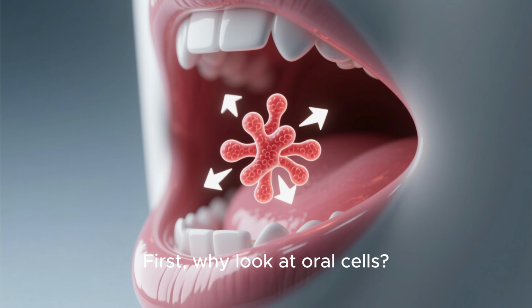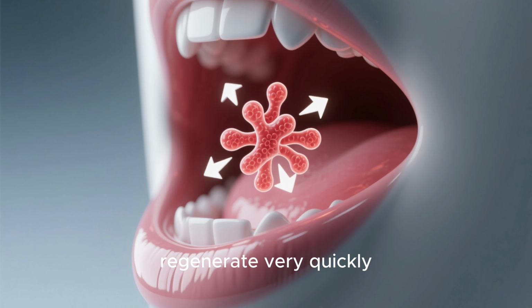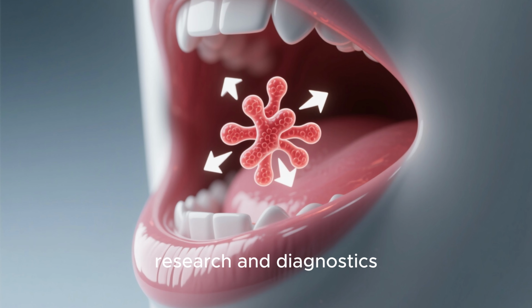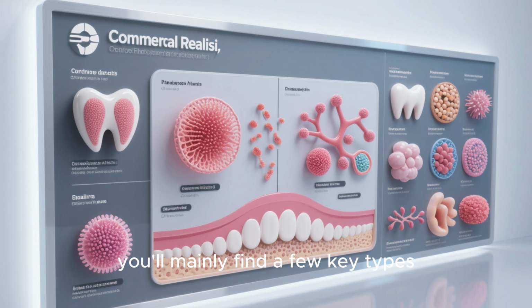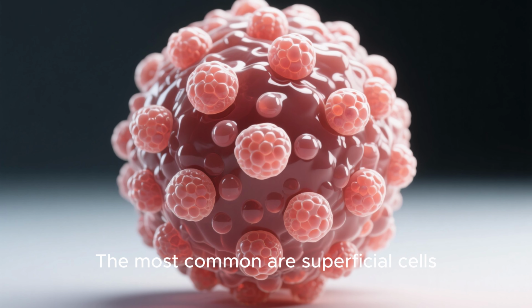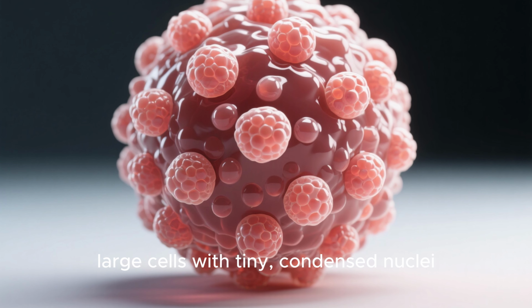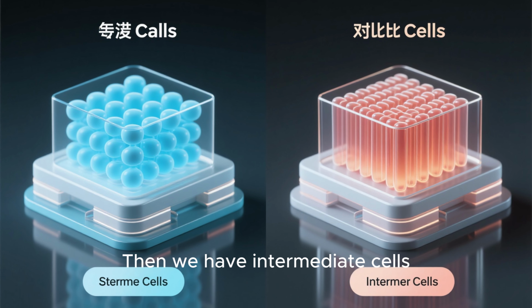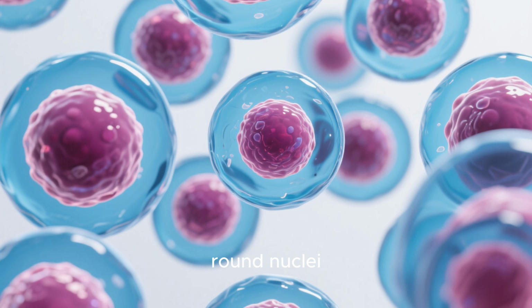First, why look at oral cells? They're incredibly easy to access, and they regenerate very quickly, which makes them perfect for both research and diagnostics. Inside your mouth, you'll mainly find a few key types. The most common are superficial cells. These are mature, large cells with tiny, condensed nuclei. Then we have intermediate cells, which are a bit less mature. You can spot them by their clear, round nuclei.